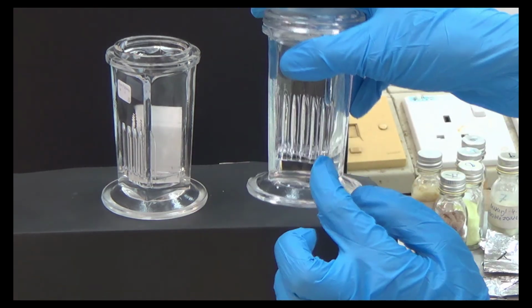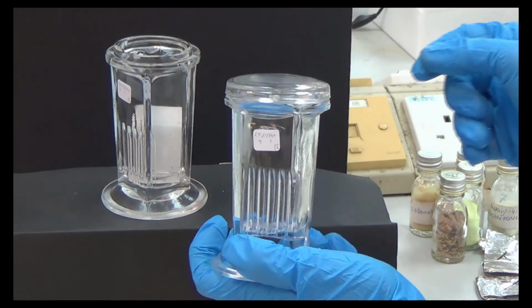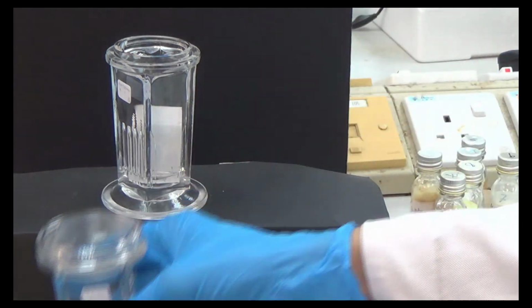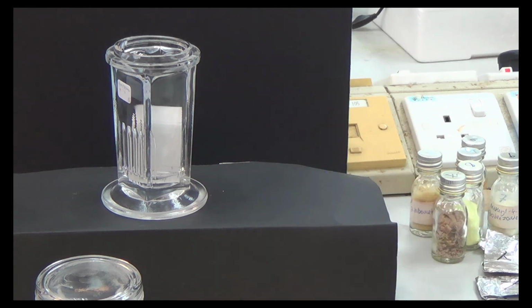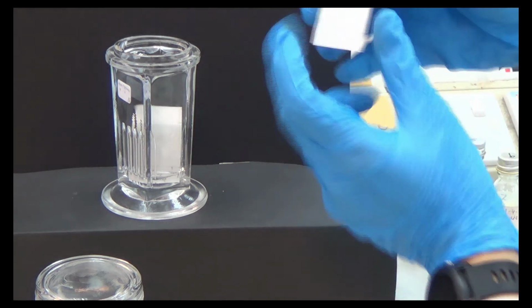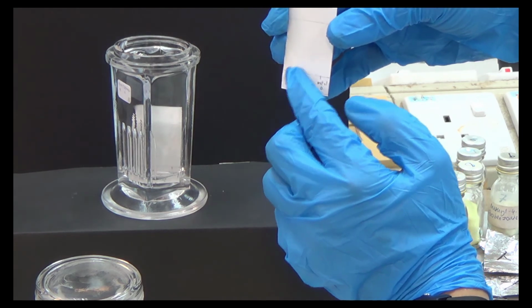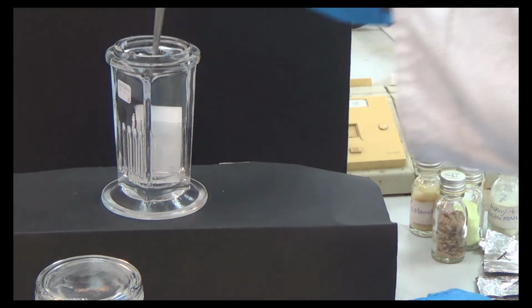We use the same solvent, and then we put three plates, right? We do not contaminate this solvent, because remember we have a line here. So the solvent is below the line, and the compound is on the line. That's why it will not contaminate. Okay, we take it first before I forget.